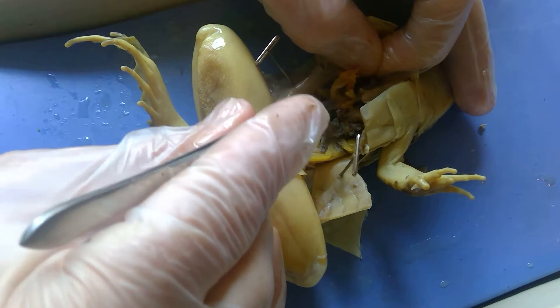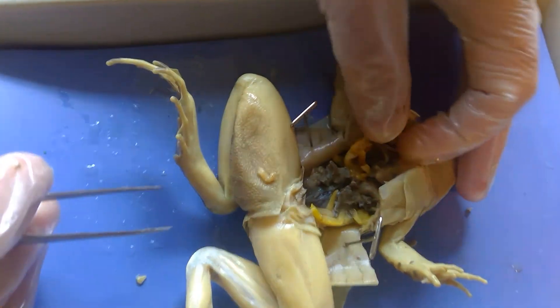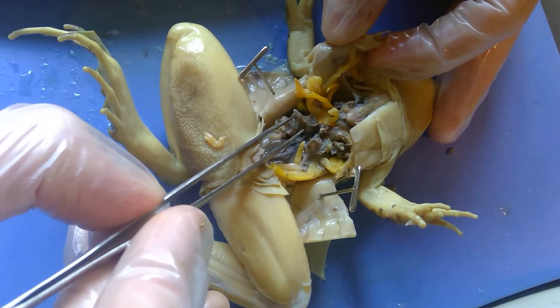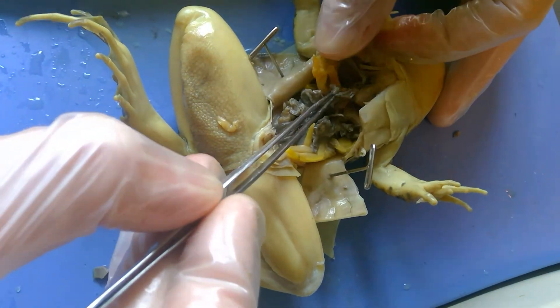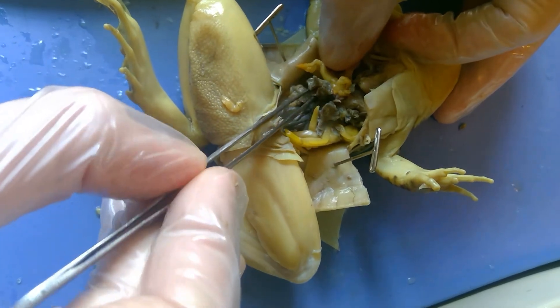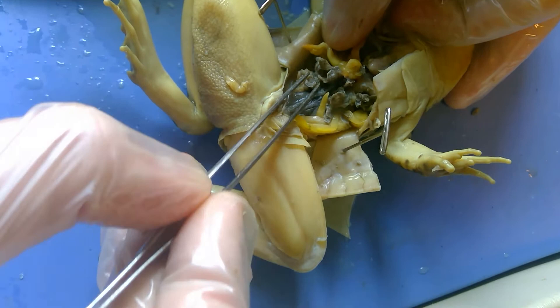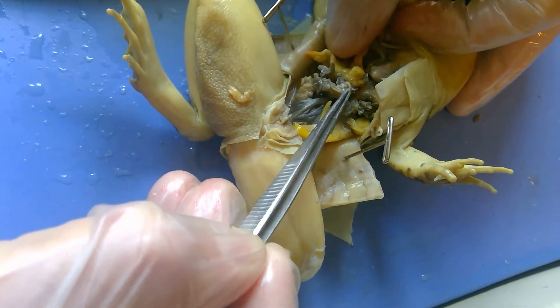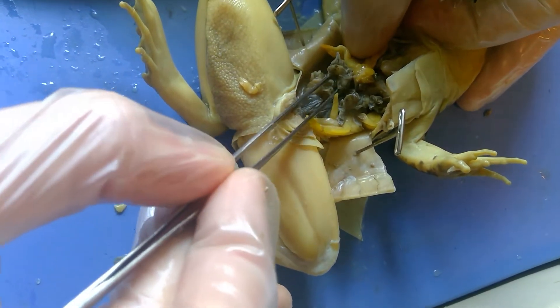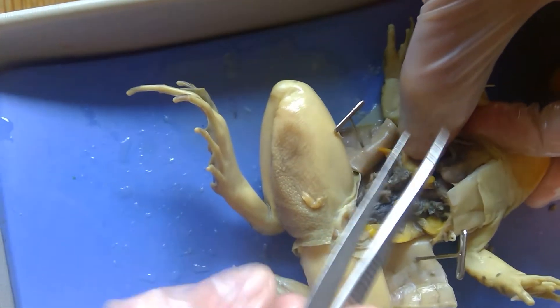Below the fat bodies — these are the fat bodies right here — is going to be the gonad. This frog is a girl, it's a female, because that right there is its ovary.